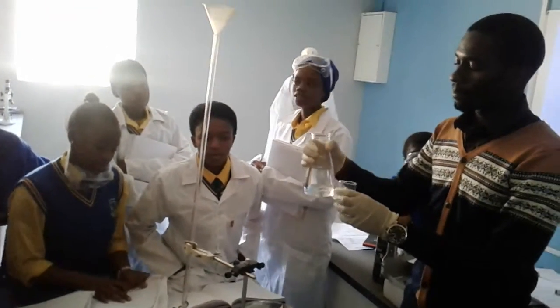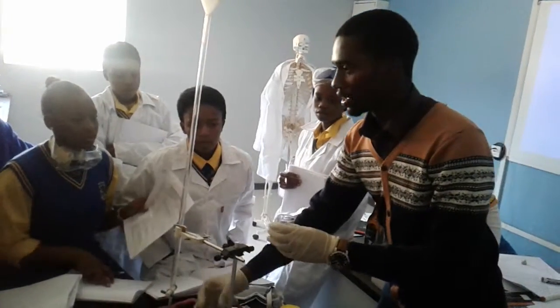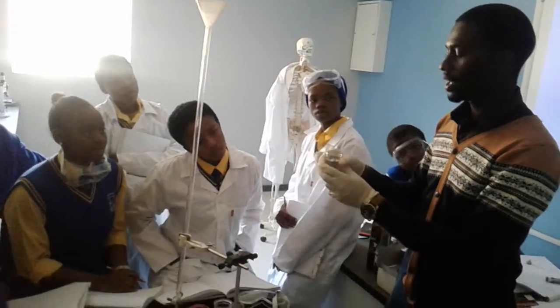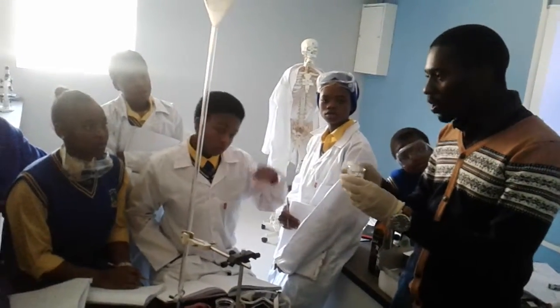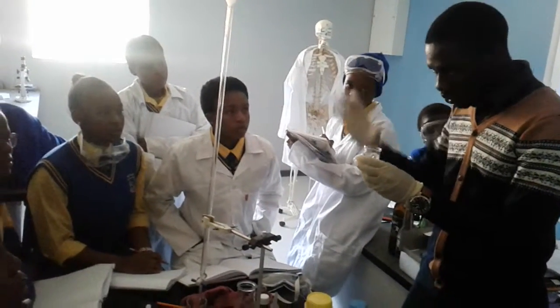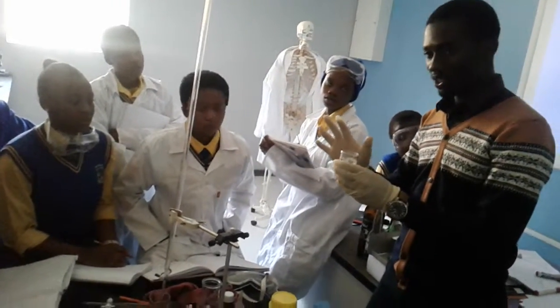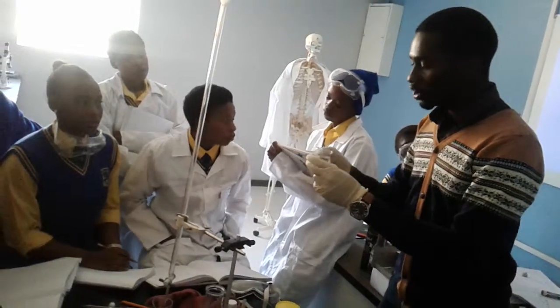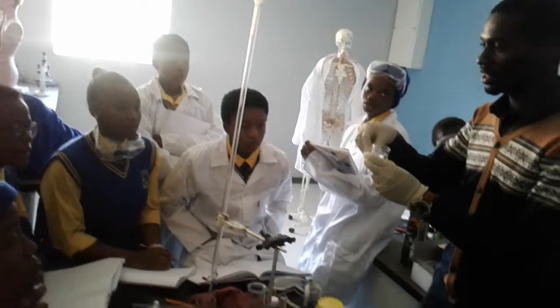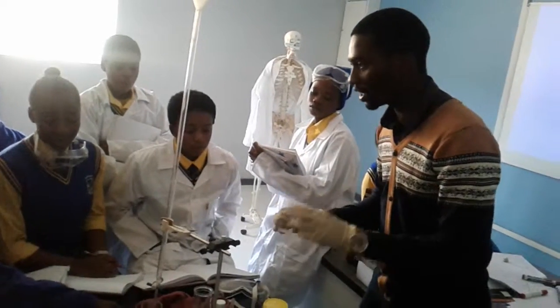What I'm doing, this is what I call a solution. Why is it a solution? Because I'm mixing something in water. Now, water is the solvent. The small thing is called the solute. So in a solution, there's a solvent and a solute. Now, this is going to sound confusing, but just listen. The solution is a mixture of the solute inside the solvent. So if I put the solute inside the solvent, then it's called a solution.